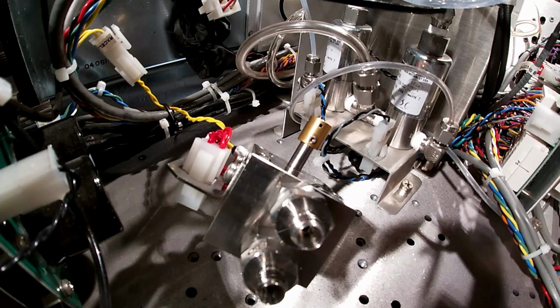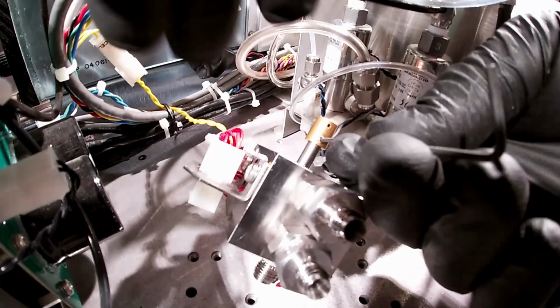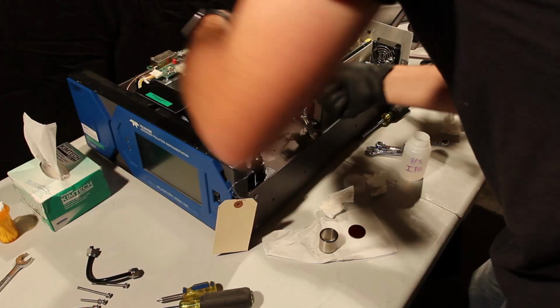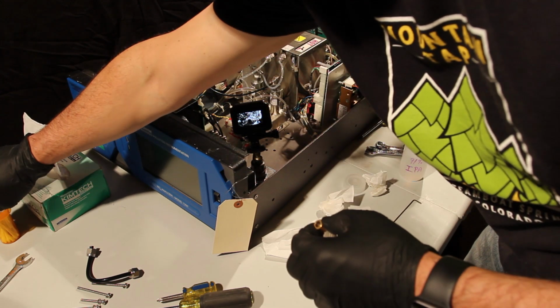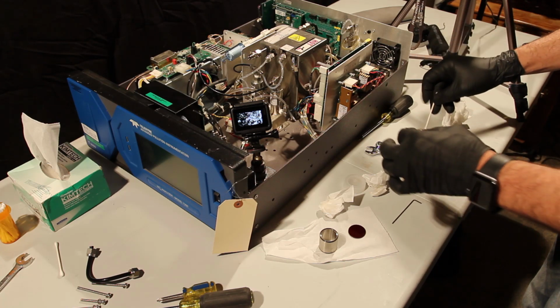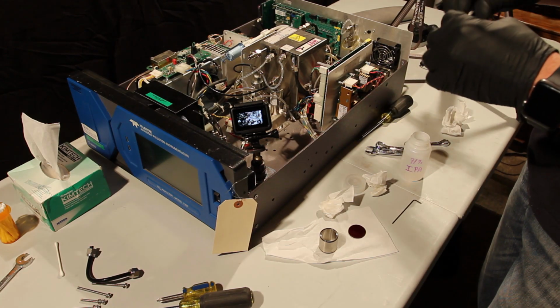Okay, I've grabbed a 16th inch Allen wrench here, and what I'm going to do is remove this gold colored nozzle director. Should be pretty loose. We want to clean this thing out as well. Use a Q-tip with some isopropyl on it. We'll be able to get down inside there, get all that crud out.